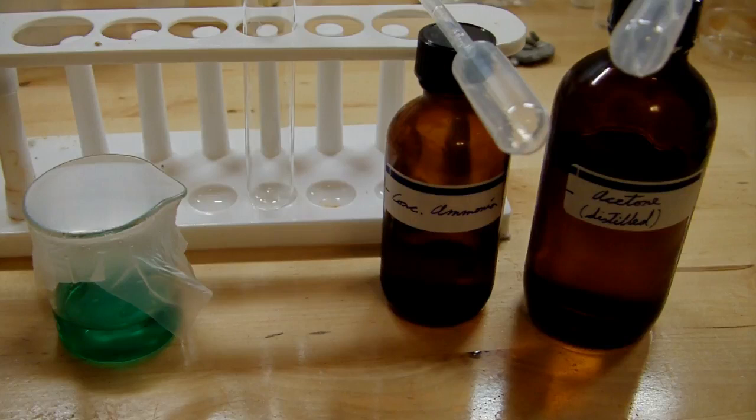Hey everyone, in today's video I'm going to be making a compound called hexaaminenickel(II) chloride, perhaps the longest named chemical I've ever made.